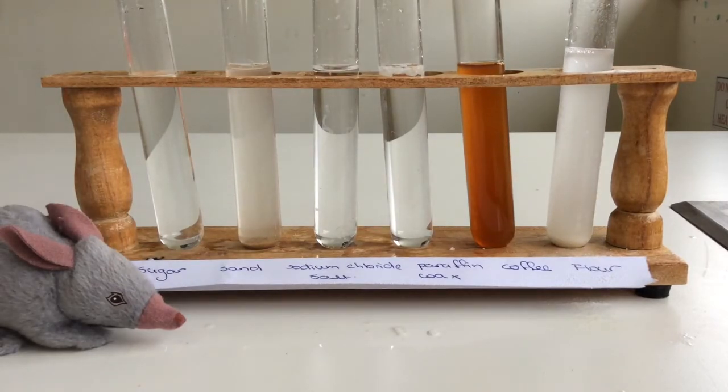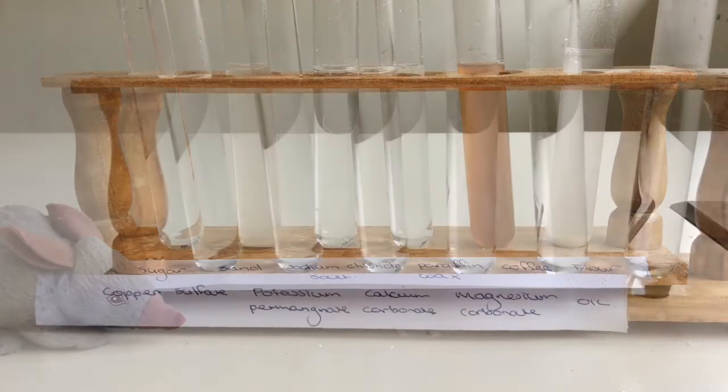Okay, so I hope you've been able to make your observations of those 6 common household substances. We're going to go and do another 5.